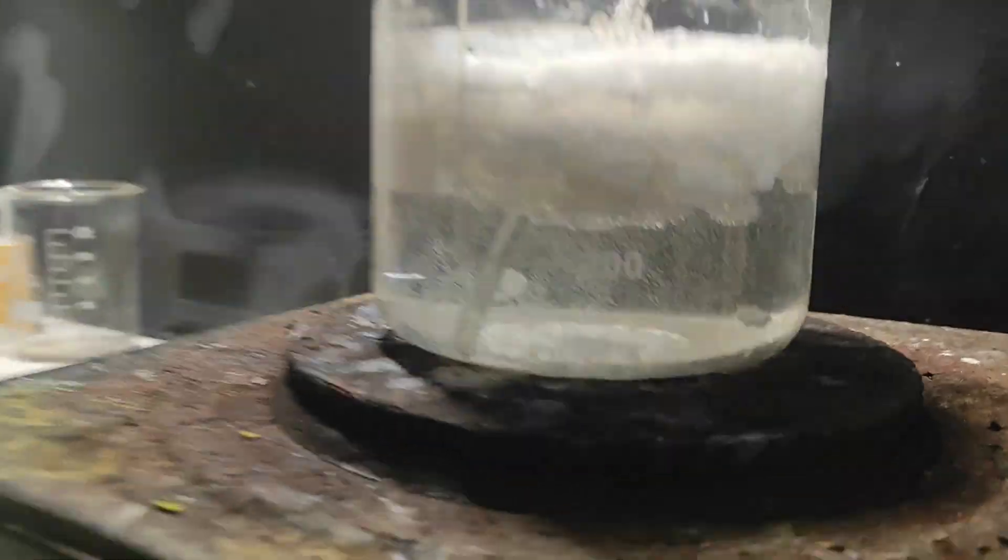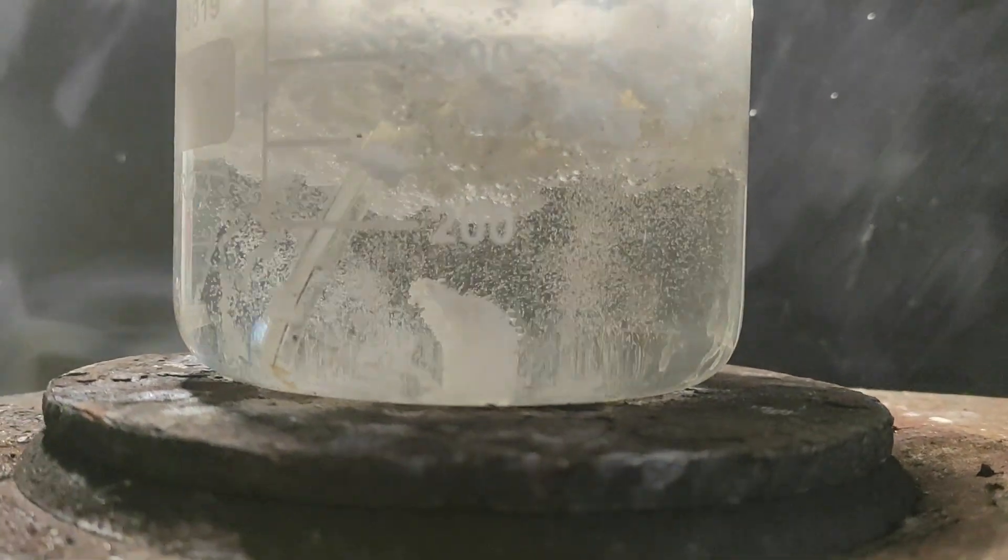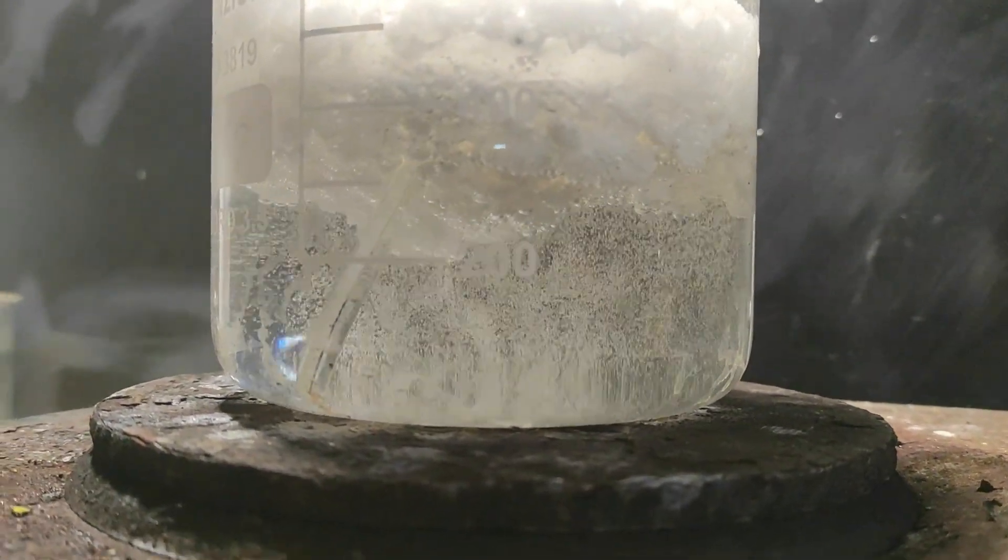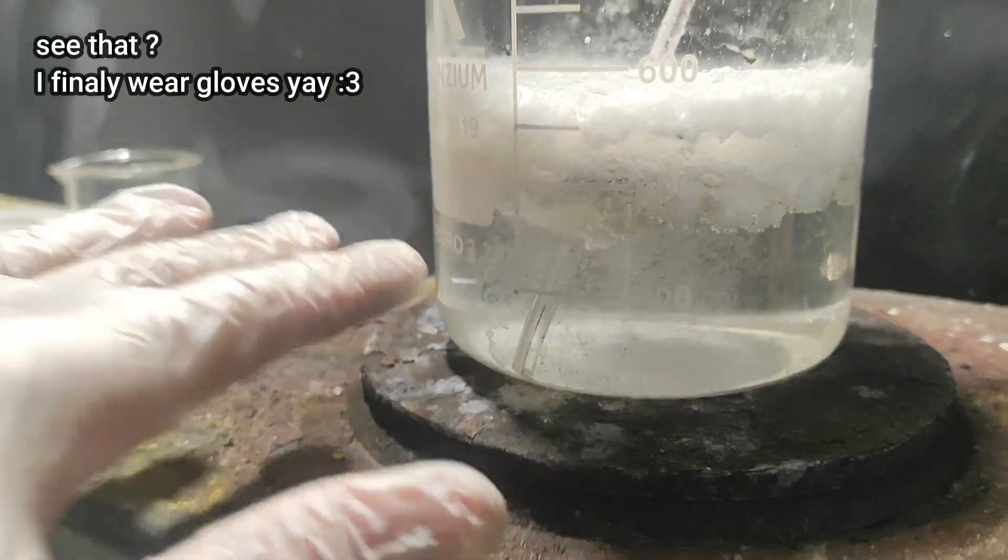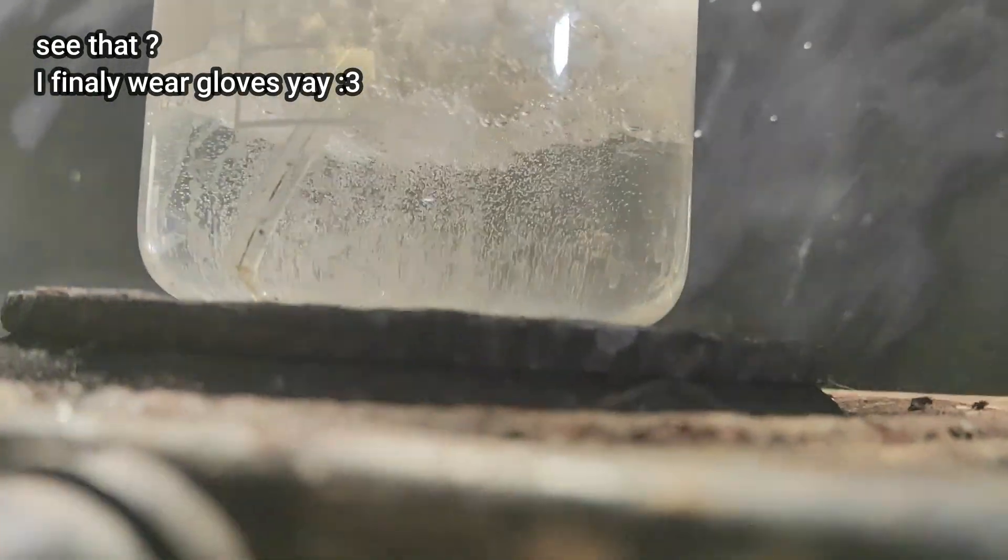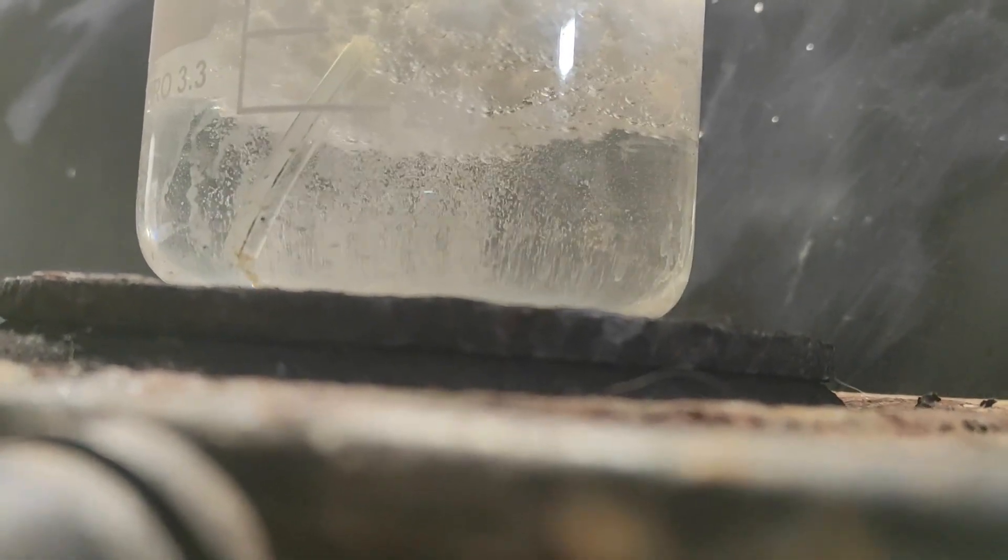Oh, there's a nice visual effect. Let's take a look. The bubbles are carrying the benzoic acid. It's very funny. Usually it was sunk on the bottom, but now it's on the top. Very cool looking. Very nice.